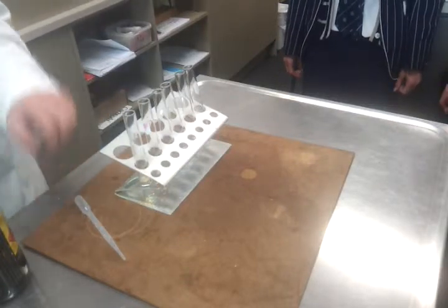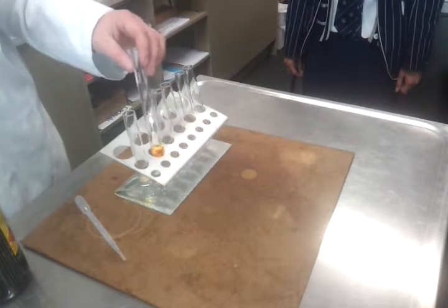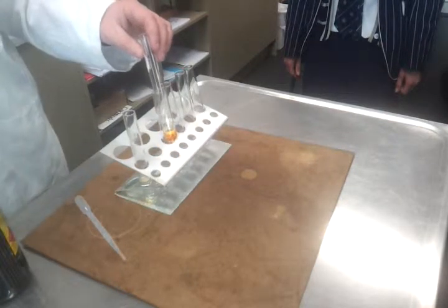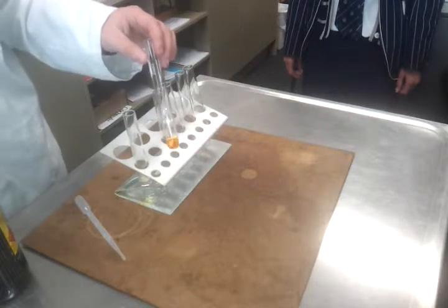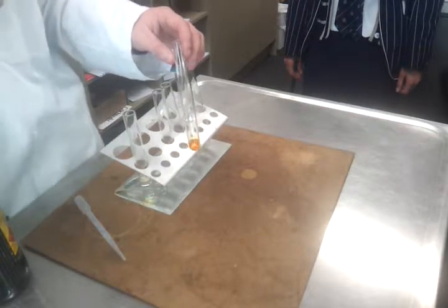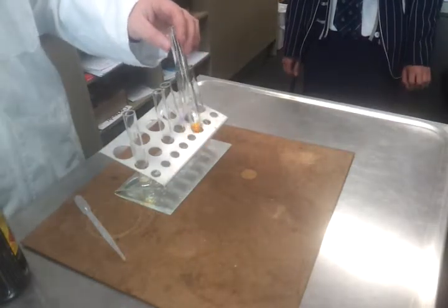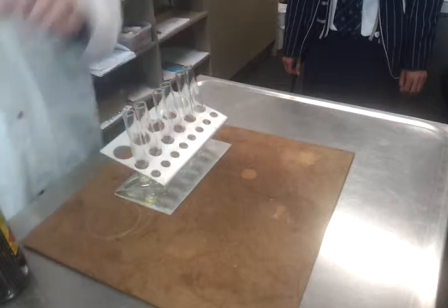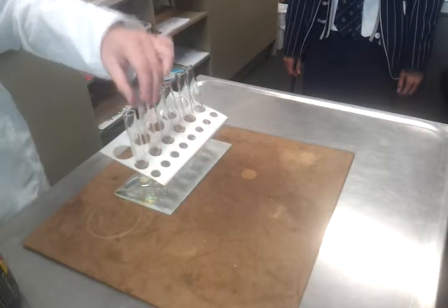So if there's enough activation energy and so on, we would expect that the bromine, being what we call a highly electronegative element, is able to be attracted to the nucleus of the carbon, substituting out a hydrogen. So we'll see what happens with this and see if that is exactly what happens or not.